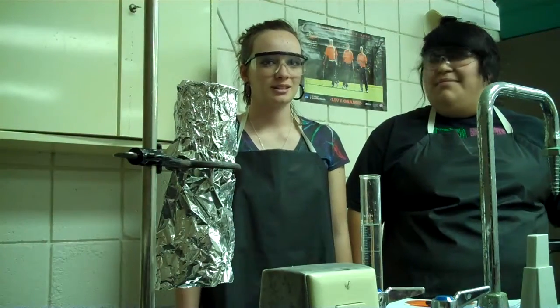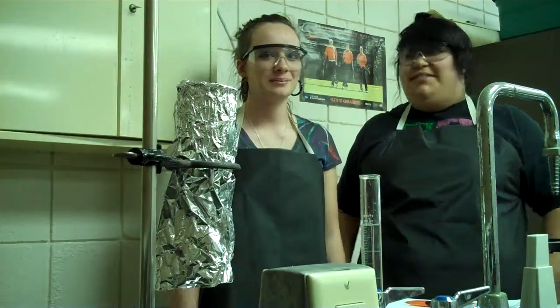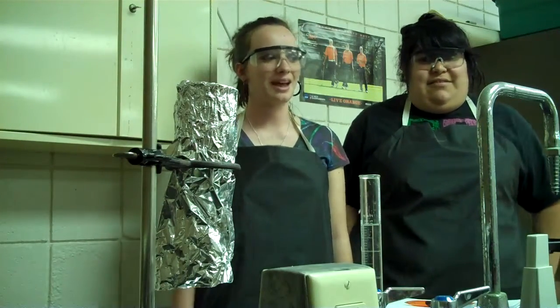You're alive. My name is Jessica Marshall, and I'm Jessica. We're going to do a Frito lab to compare the calories of a real Frito compared to the bag.